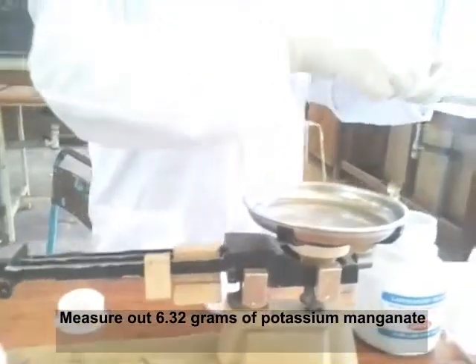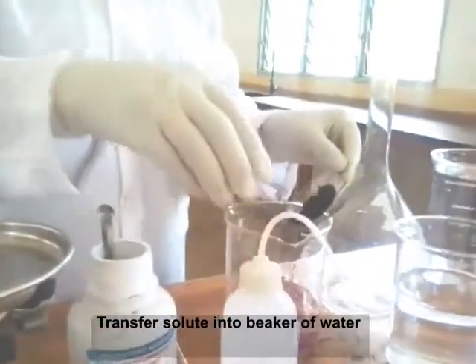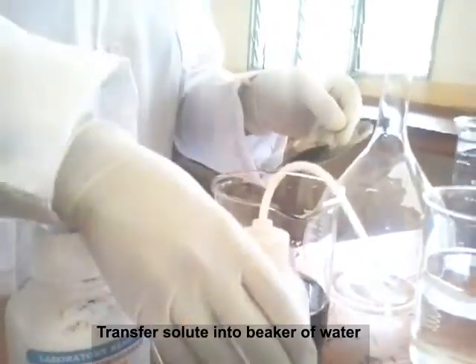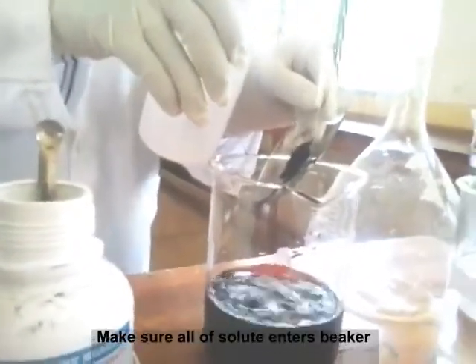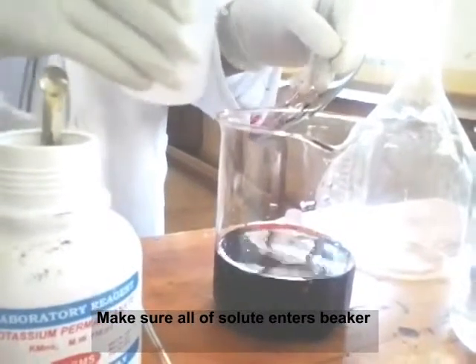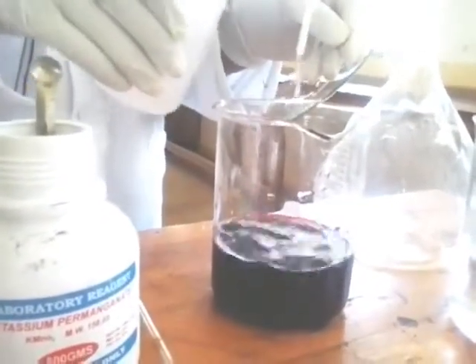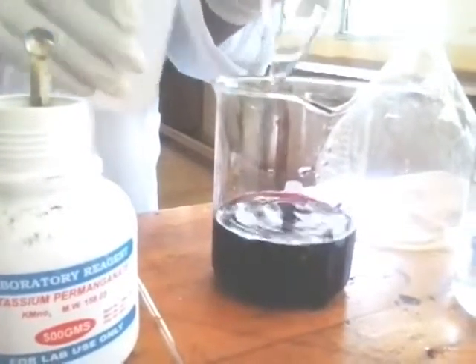We transfer the solid into the beaker containing an estimated volume of water. We make sure that we rinse the watch glass with water until the solid sample is fully introduced into the beaker.